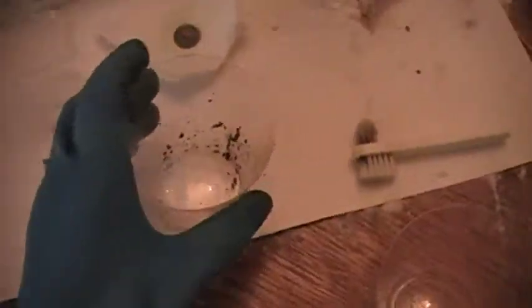That one smells really bad, it's weird. Really nasty. But what it will make — I'll just show you this — I got all of it out pretty much, but it will just make these, like, brown, black blobs in there. And that is copper.